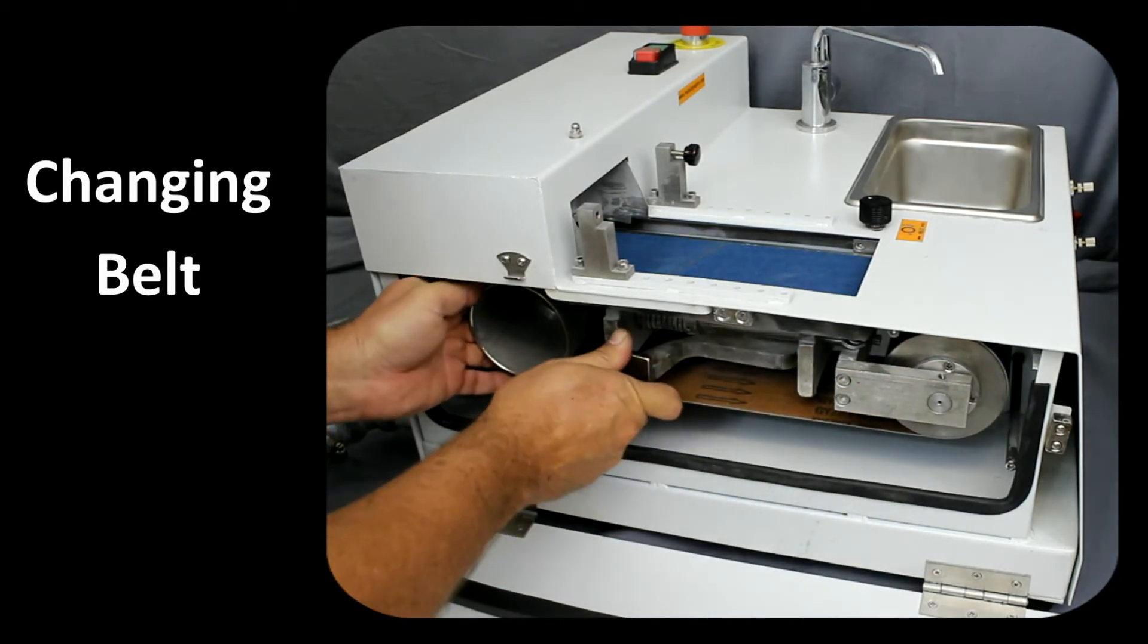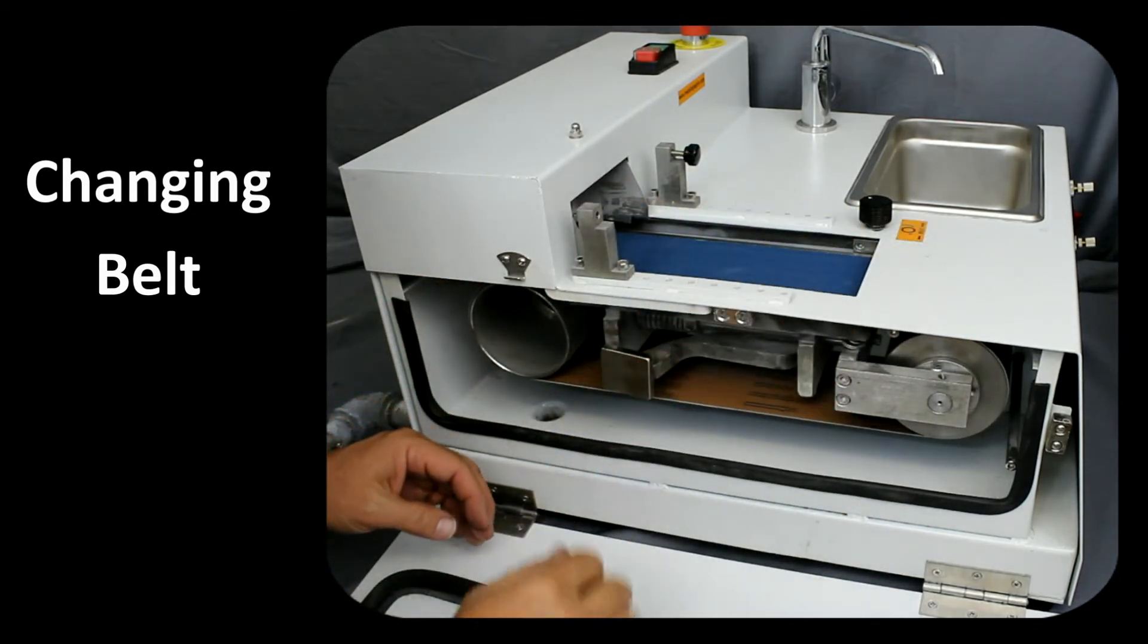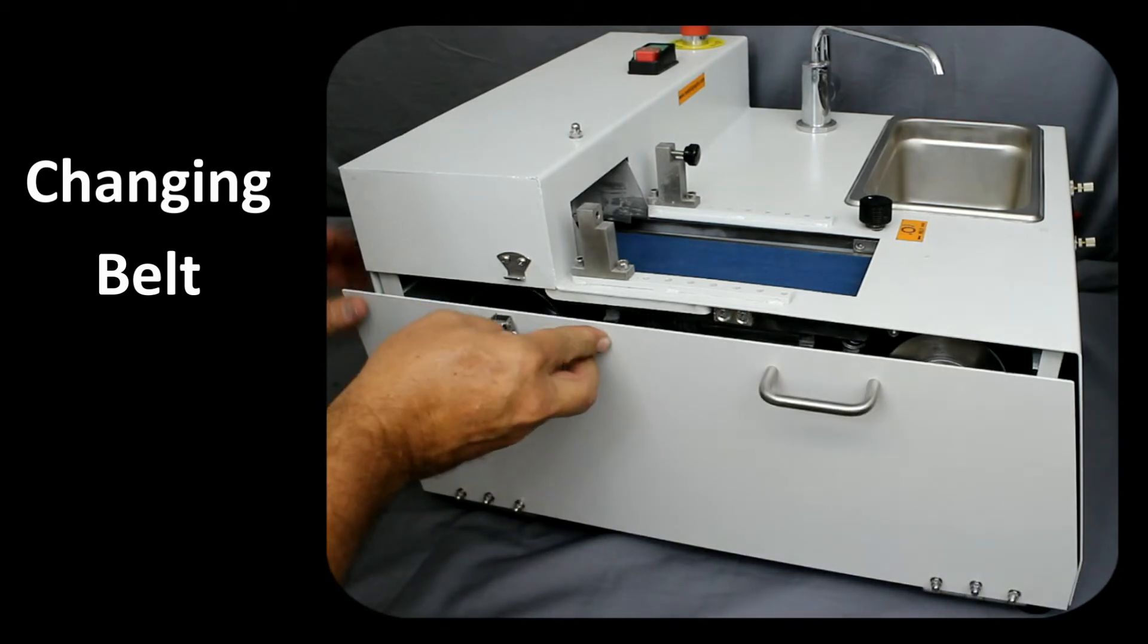Check to see if the belt spins freely. It is also recommended that the belt tracking be adjusted before closing the side panel.